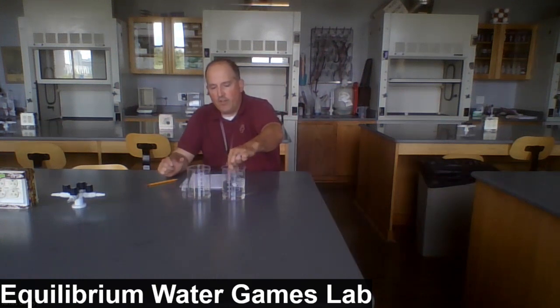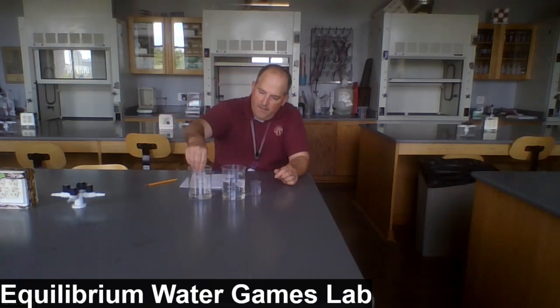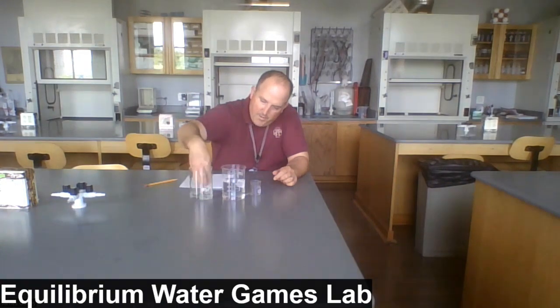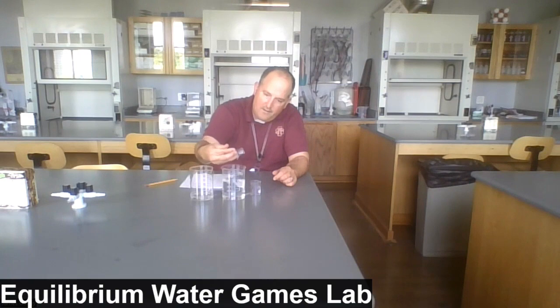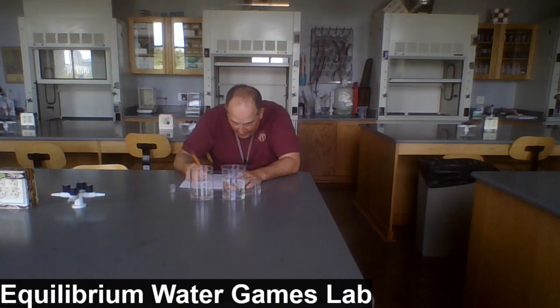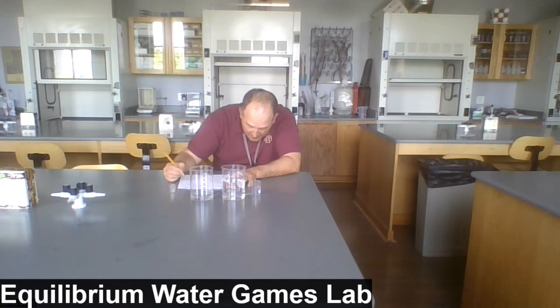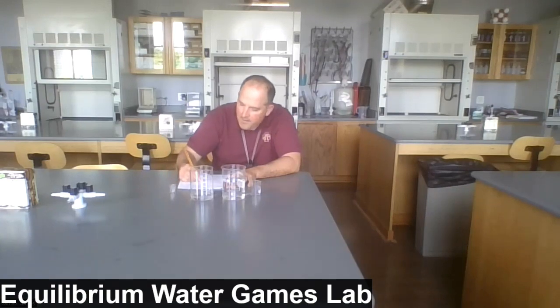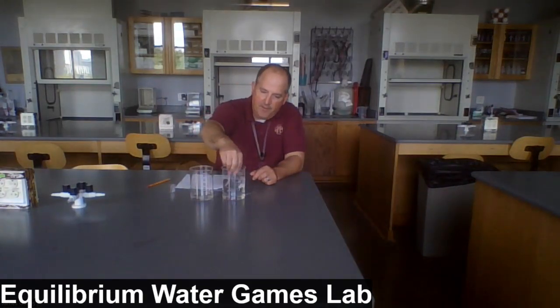I'm going to try transfer cycle 2, moving as much water as I can from beaker A to B, and then as much water as I can from beaker B back to A, trying to get it as full as I can. Get a little more water this time. And now the new volumes after transfer cycle 2, I'd say we're at 400 milliliters in beaker A, and I'm going to put that at 110 milliliters of water in beaker B. That's after transfer cycle 2.